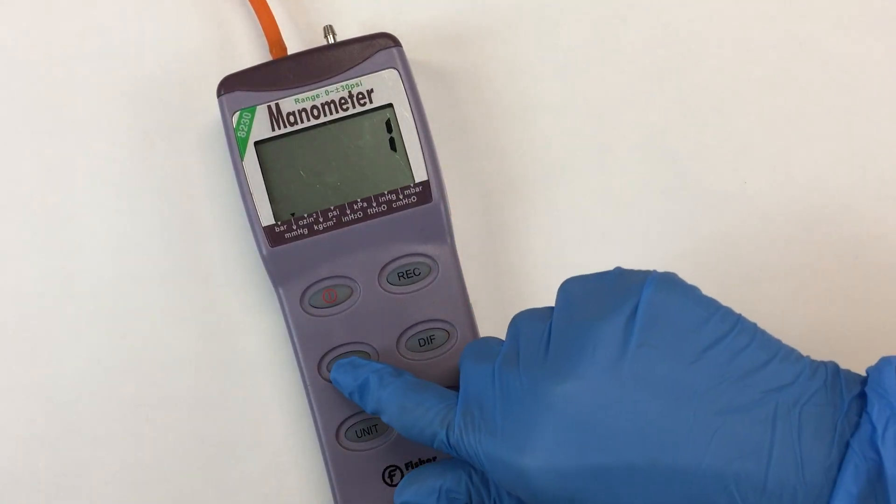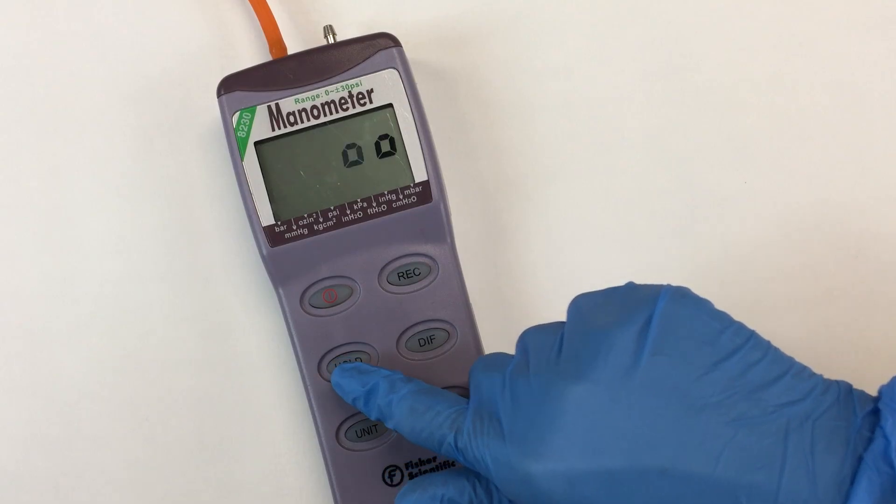To zero the manometer, press the hold button for a couple of seconds, then release it.